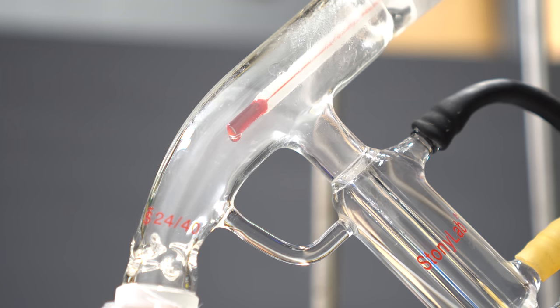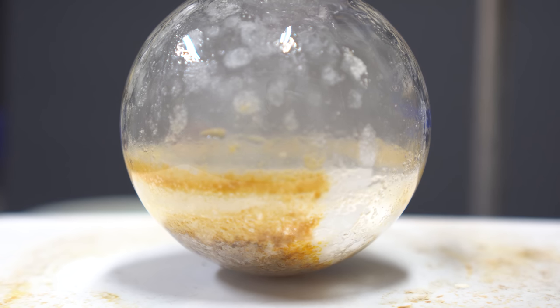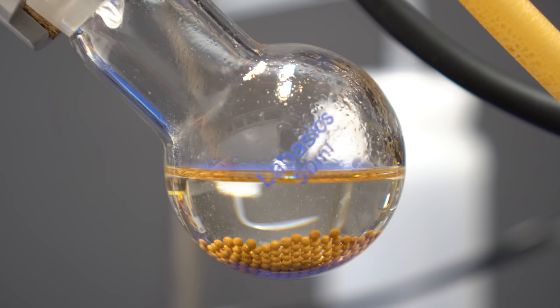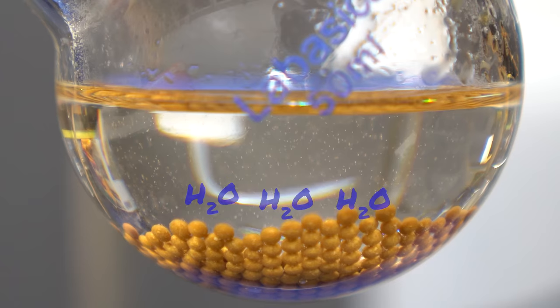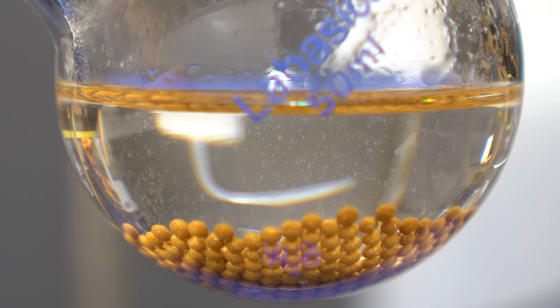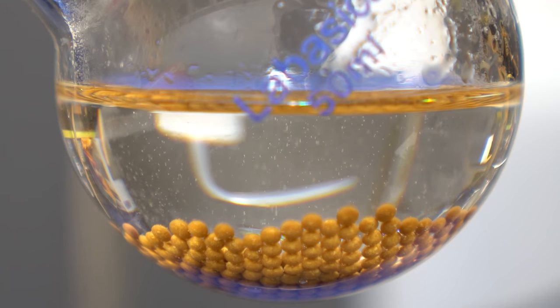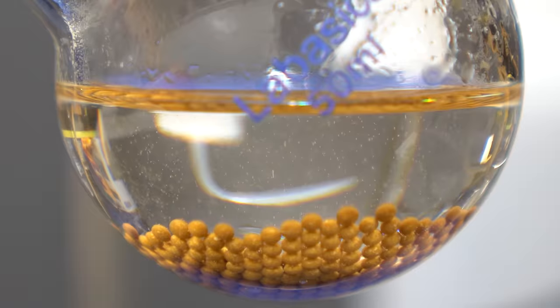Once an insane amount of vapor started being produced, I stopped the distillation. Most of the pyridine was gone, and we just had this junk at the bottom. In case you don't know what a molecular sieve is, it's a material with pores of uniform size. The 3A sieves that I have selectively pull water out, but they won't pull the pyridine out. This makes it useful for drying a variety of solvents like ethanol and a lot of other ones.